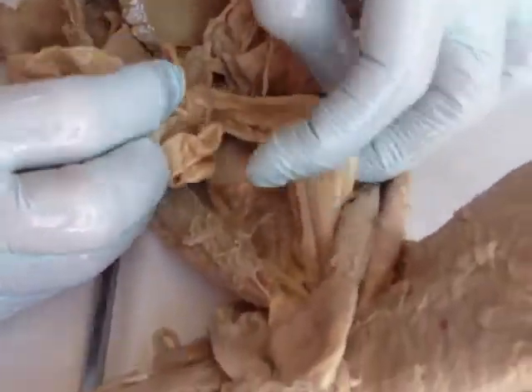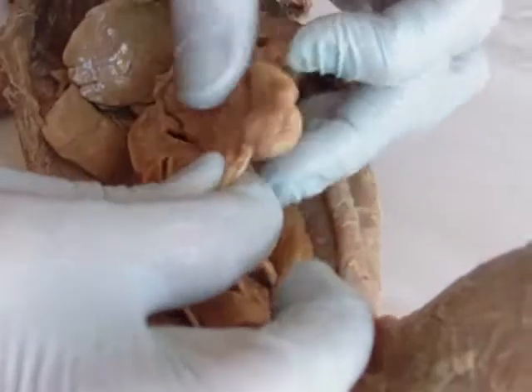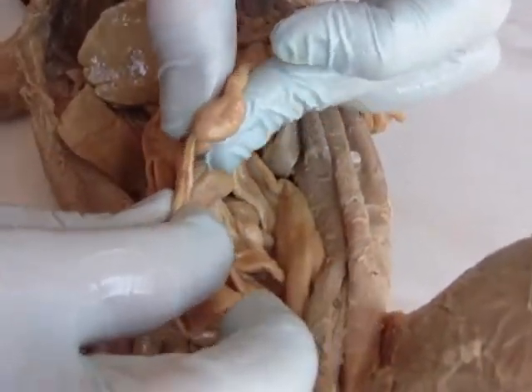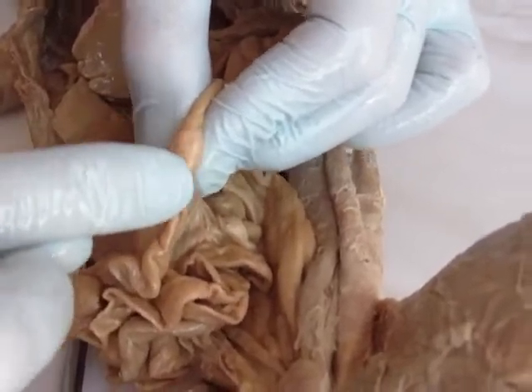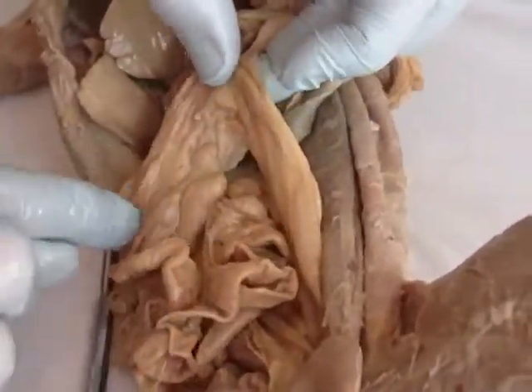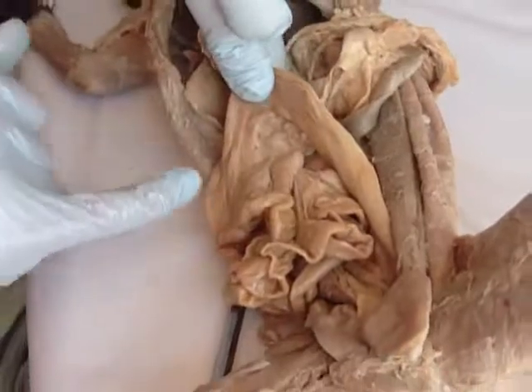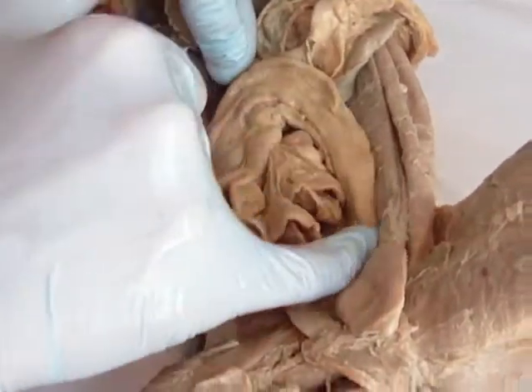I'm going to follow your large intestine all the way up so you can find the end here. This tube coming into your large intestine is your ileum. The very end of your large intestine is your cecum, and they're connected by an ileocecal valve. Now you have your question-mark shape — the large intestine. Ascending colon here, transverse, descending.